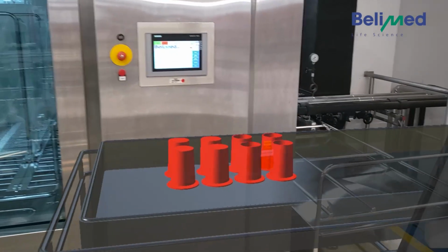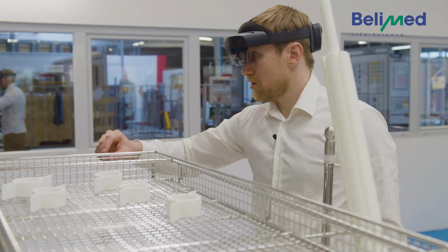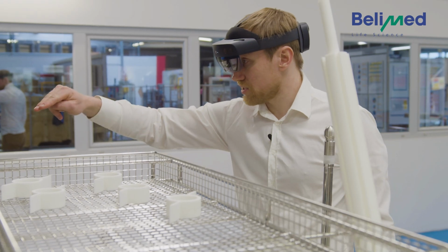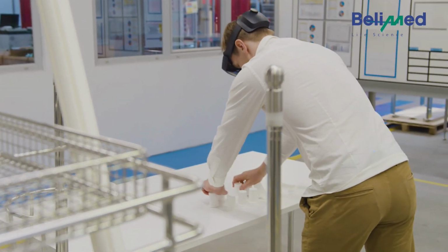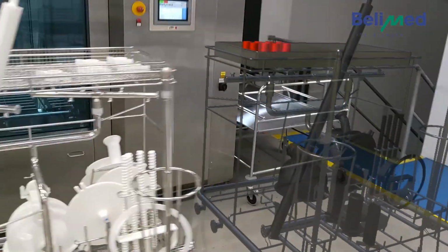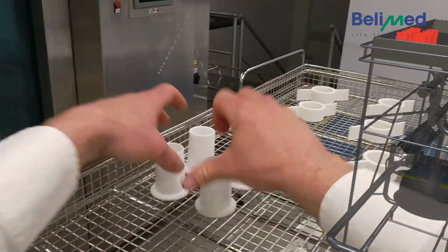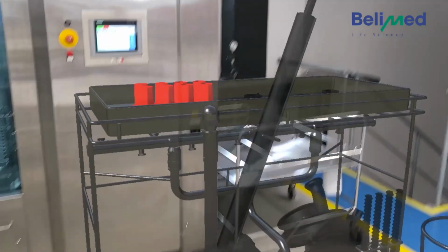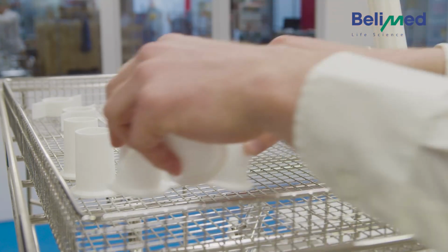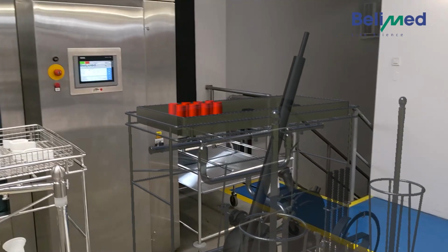So now we have eight parts, the open ones and the closed ones. So the closed ones, the closed side is on the top. So you take the open ones first. Place them here. And now the closed ones directly next to them. Check.